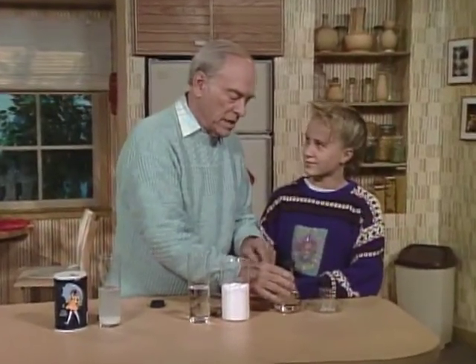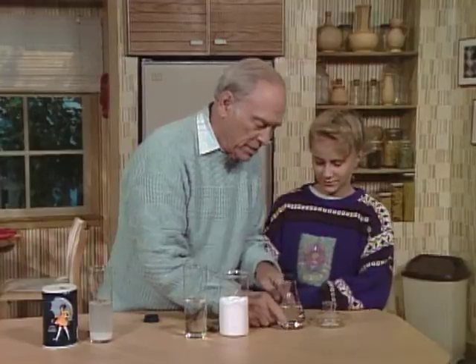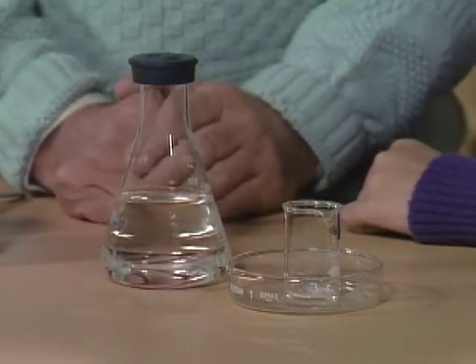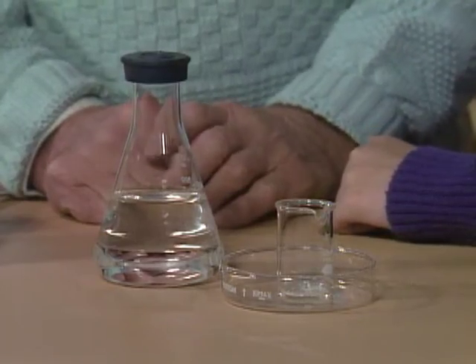Shan, before you leave today, I'm going to have you pour the liquid in this flask into that little beaker. It's not going to fit in that little beaker though. Well, you wouldn't think so, but as a matter of fact it will. How's it going to do that? Well, you'll see, because we're going to investigate a very strange form of saturation.